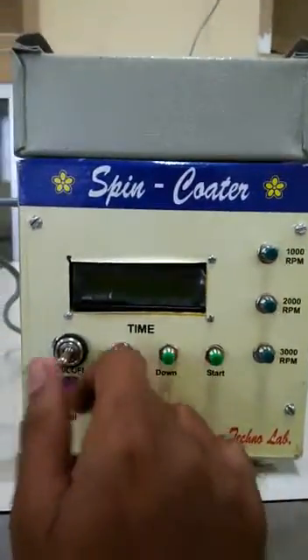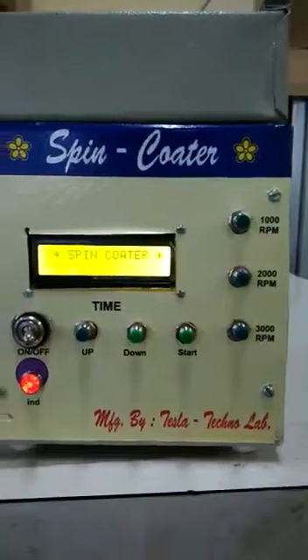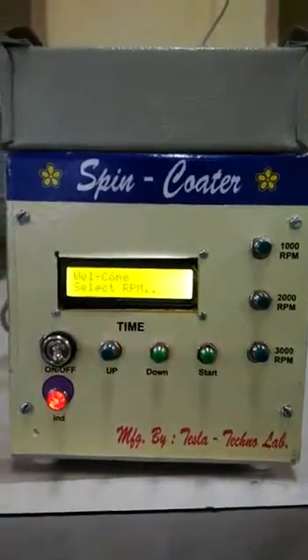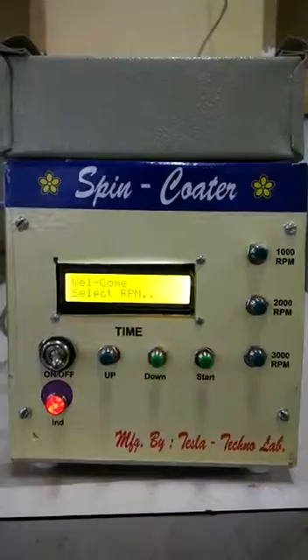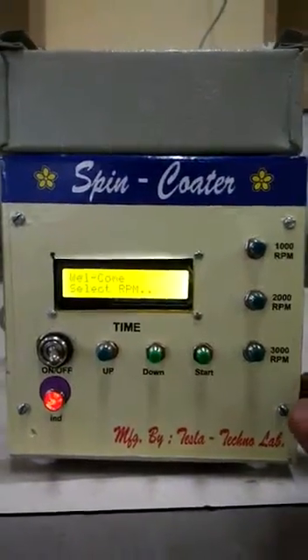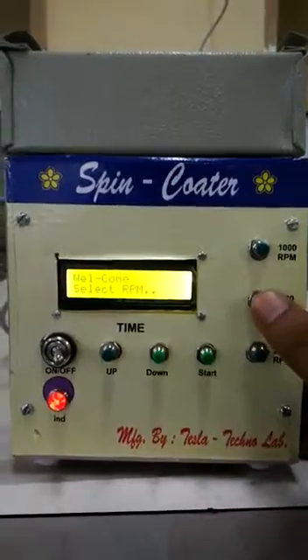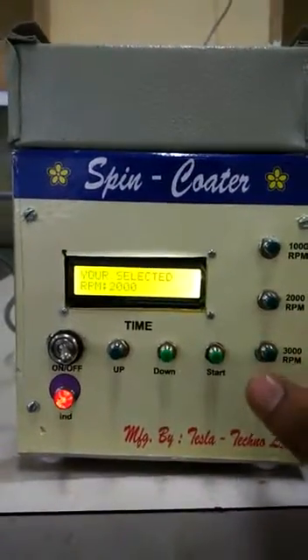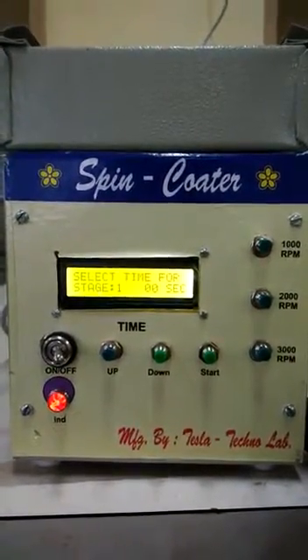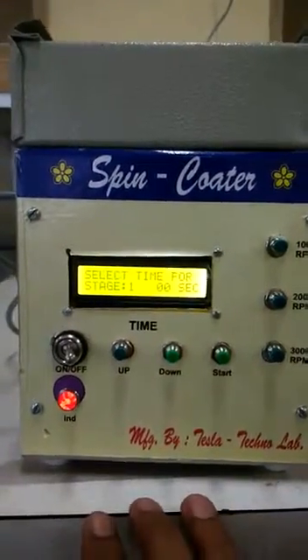Initially when you start the switch, it will display 'spin coater' and ask for the RPM — the RPM at which you want to make your samples. Suppose I select 2000; it will display the RPM and then ask for the timing.